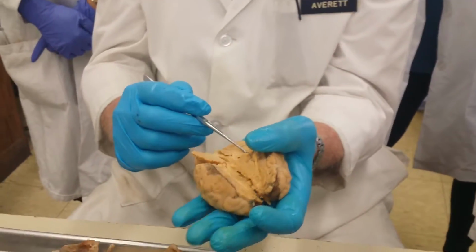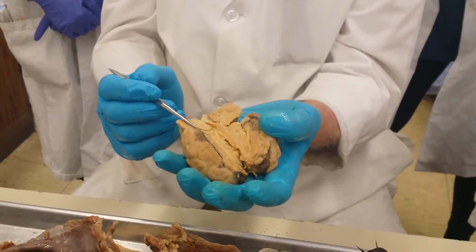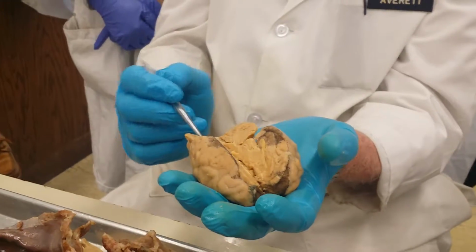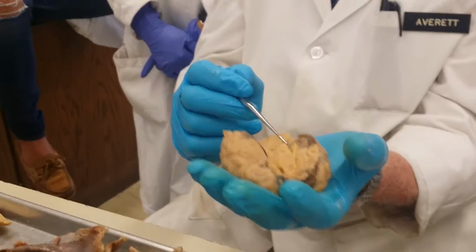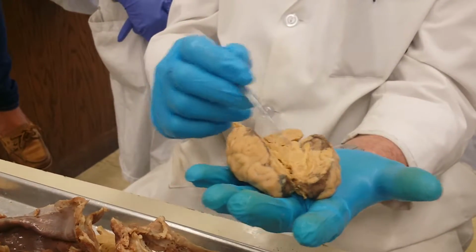And while it's not on the list, you can actually see some of the groups of nerve cells in the region of the hypothalamus. That is some of the nuclei. You can actually see several of them. Hey, what else is on that list?